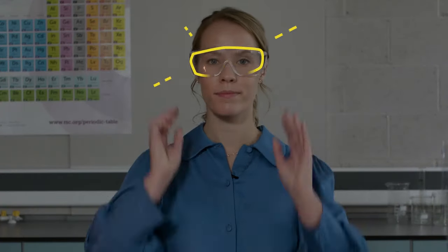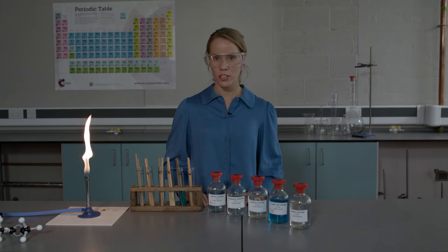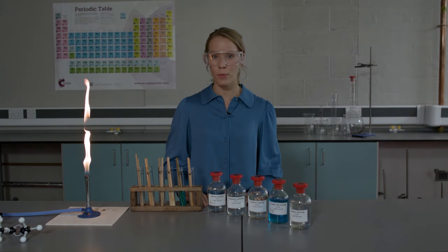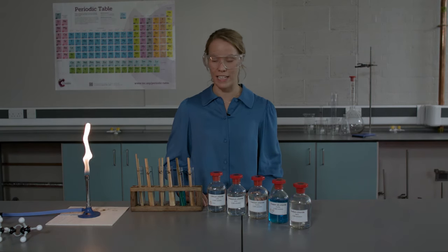The wooden splints have been soaked in distilled water for 24 hours before this experiment. That's critical — never do this experiment with a dry splint. Eye protection on. I've dimmed the lights and I'm going to change the Bunsen burner to the roaring blue flame, so that we can see the brilliant colors more clearly.